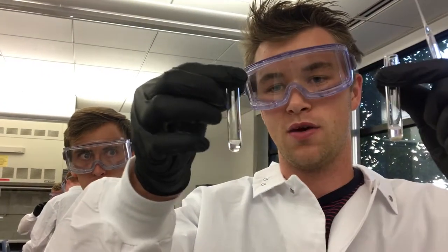Okay, I'm Jackson Small. I'm in Sammy Section 4, Chem 107. We're going to demonstrate the centrifuge.